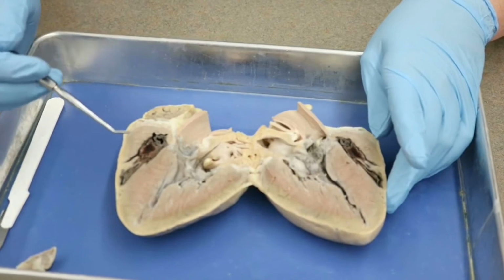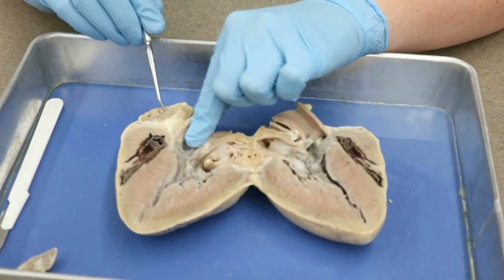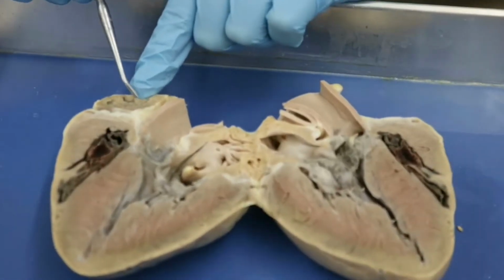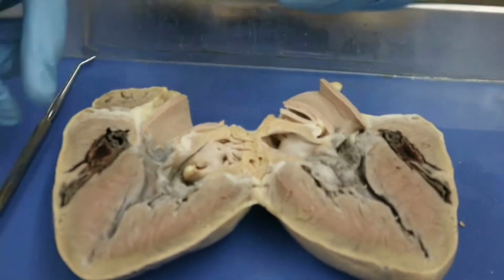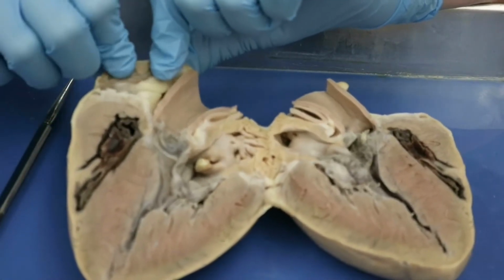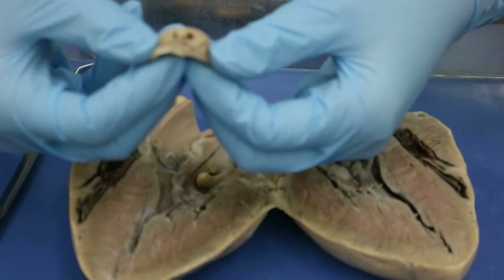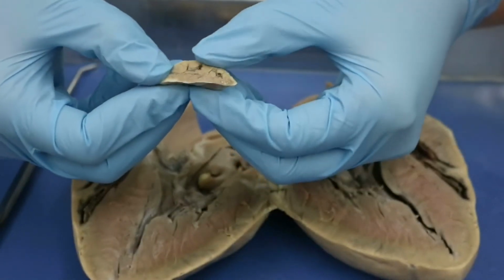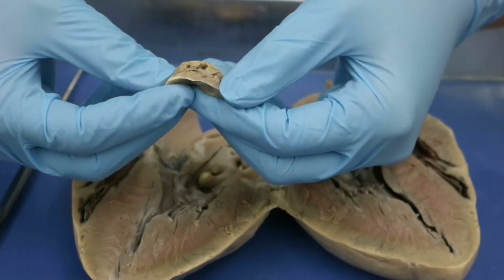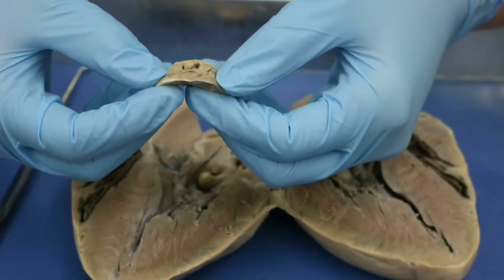And there's a few very interesting features that we can see here that we couldn't really see very well on the sheep heart. First of all, this is our auricle, okay? So this is the auricle we looked at before. And this auricle here has been cut open. Let me go ahead and do it with the piece that's cut off. So you can see that there are kind of rough areas inside of there. So this is tissue that could be opened up in the case of needing more space to hold blood. Okay, so that is the auricle there.